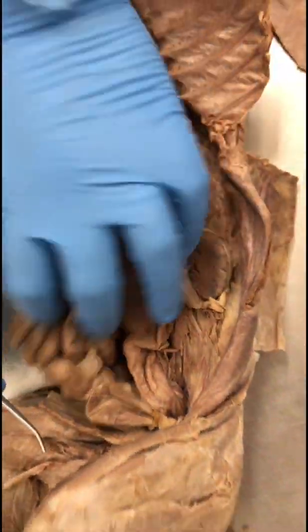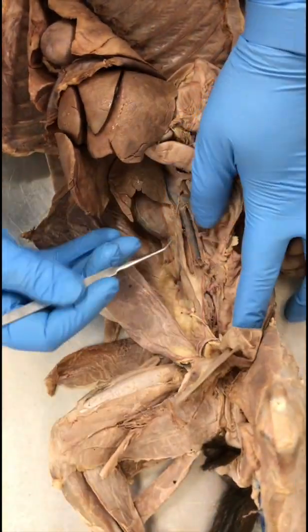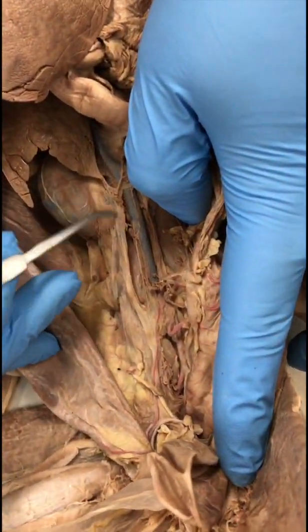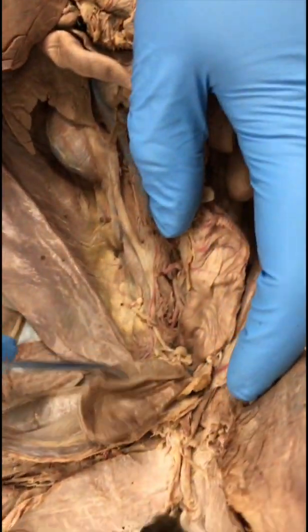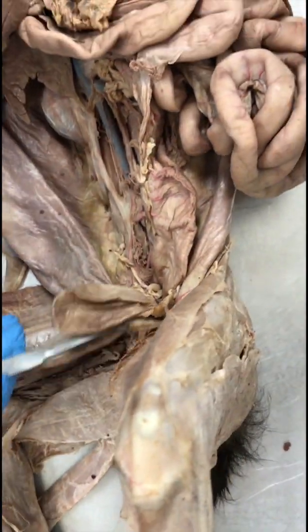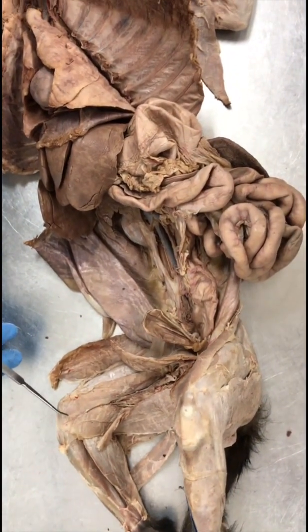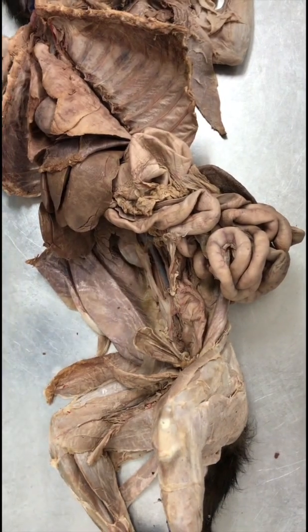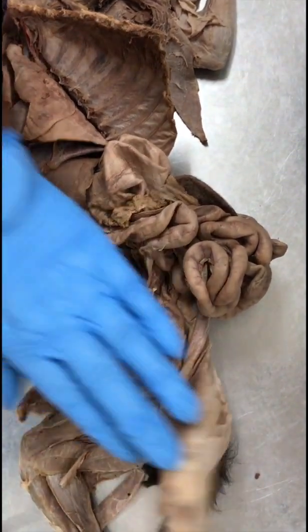Ureter. Ureter is the tube that comes out from the kidney and goes into the urinary bladder. Yeah, urinary bladder. Okay, so this is the urinary bladder right here. Urethra. Urethra is not visible in this cat, so you can ignore the urethra. Ovaries. That would be the female cat, so uterus. We can show that. Testis. Okay, so male cat.